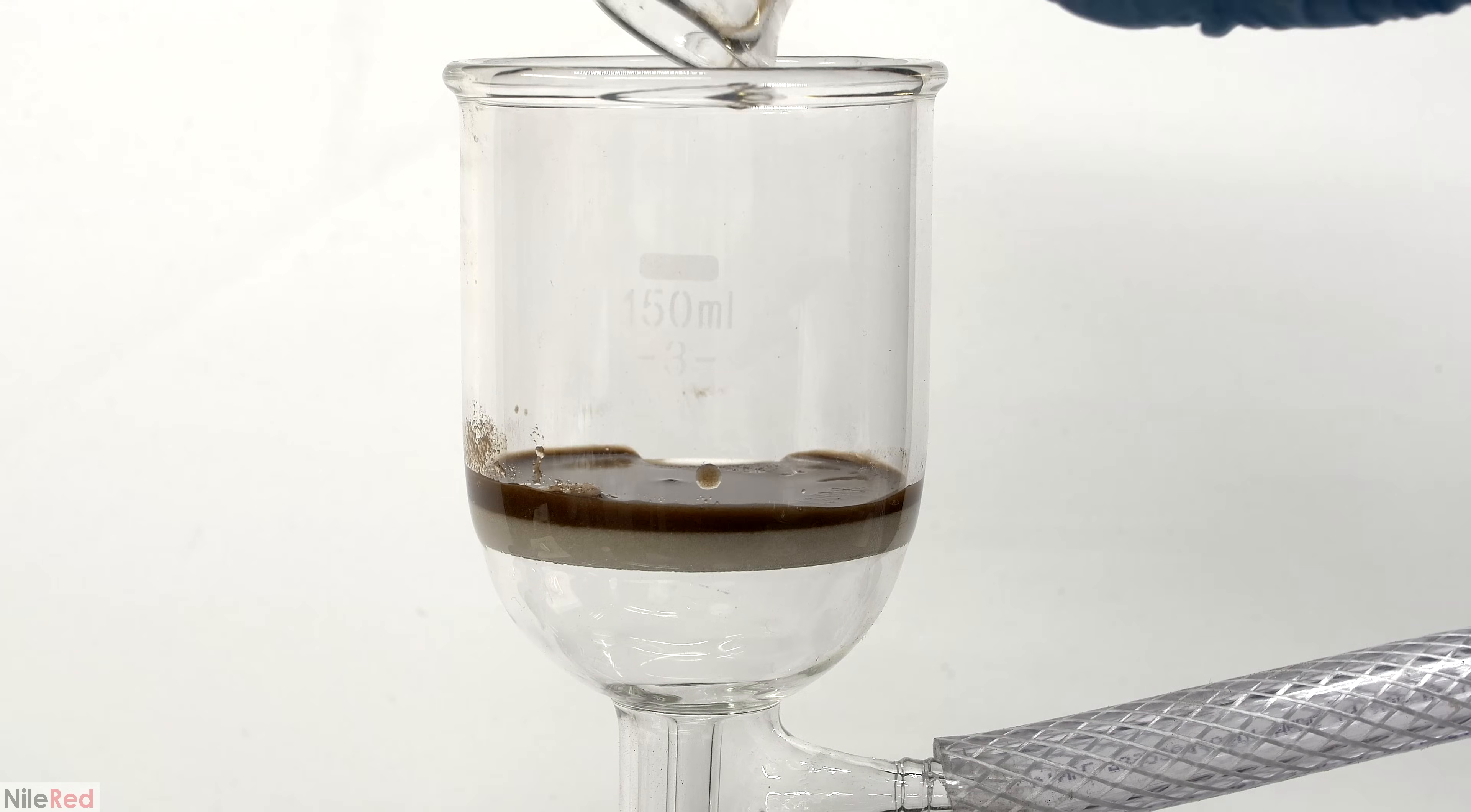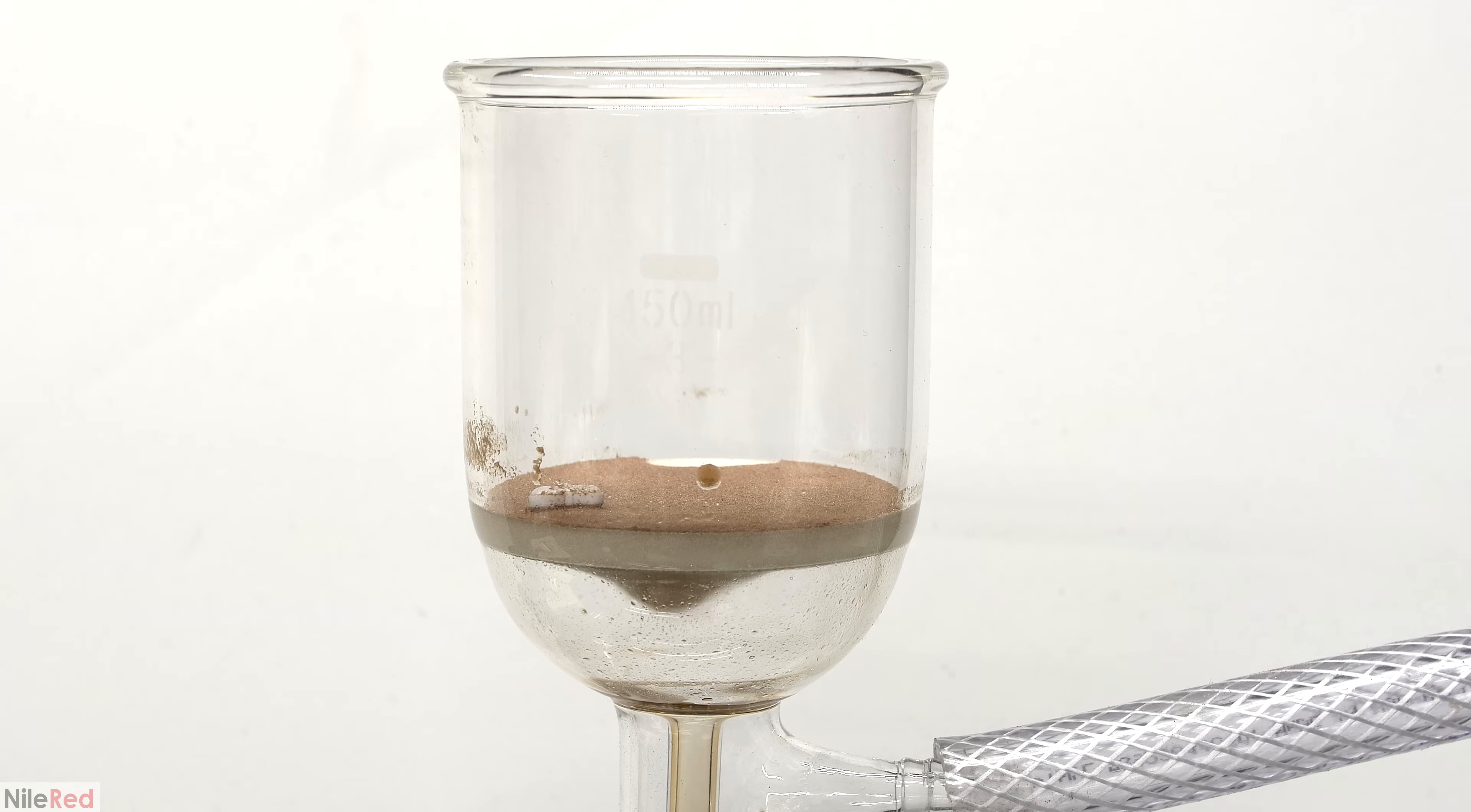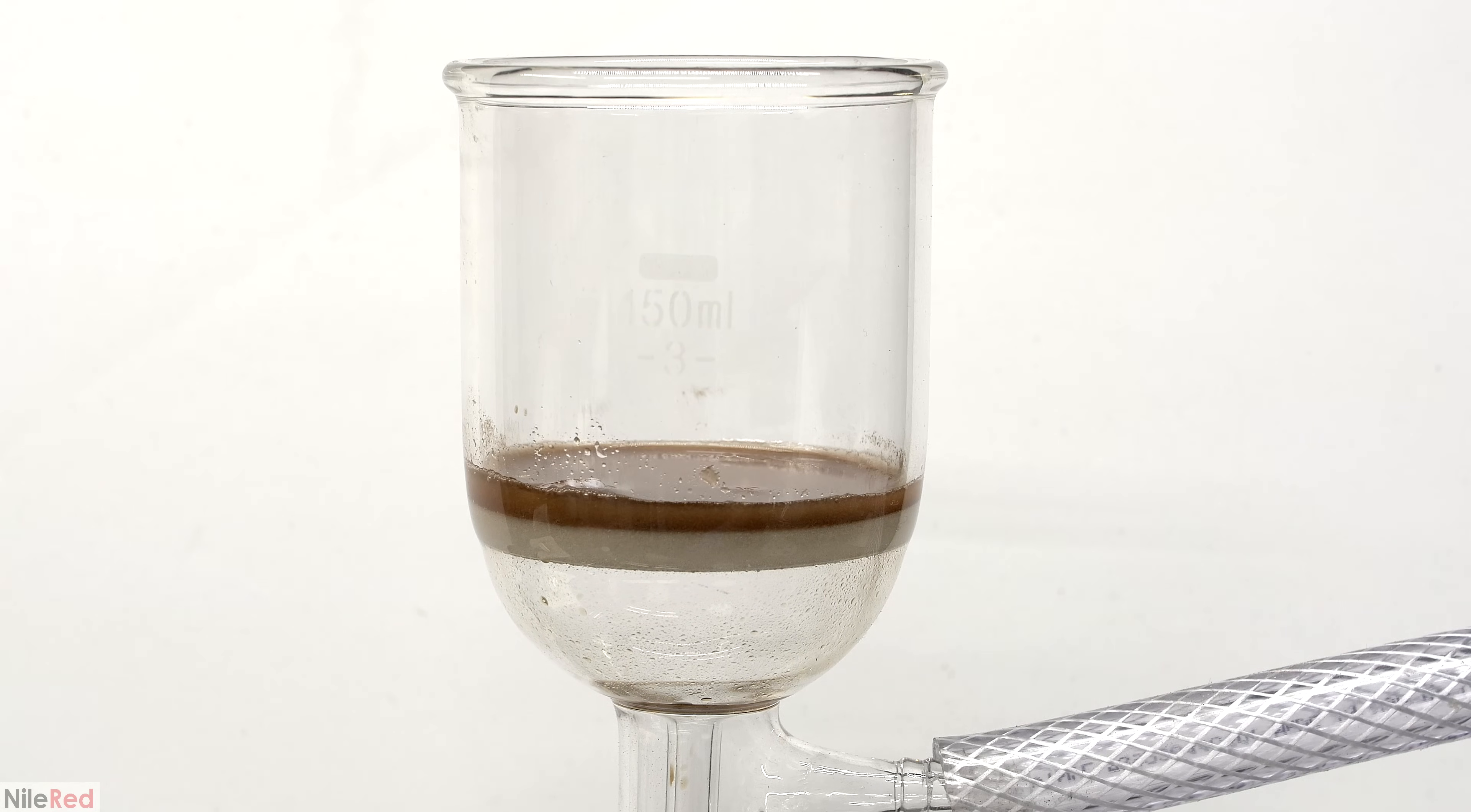Fifteen minutes later, the reaction should be more or less done, and I move on to filtering. I turned on the vacuum to pull away the brown liquid, and I washed the flask out a few times with cold water. The water helps get out any paracetamol that remained in the flask and washes the stuff already in the filter.